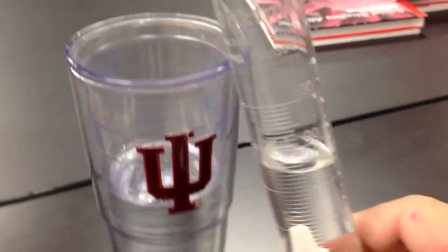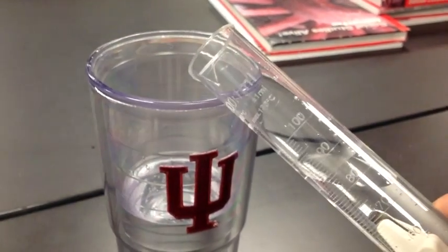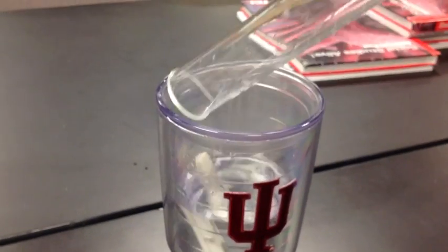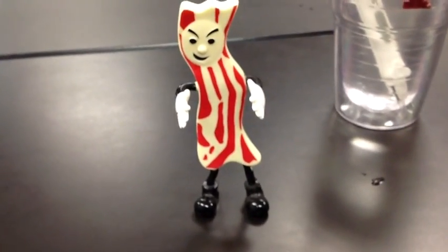To get it out, I just go back to where I got my water from. Pour it out gently and get my item out. Thanks Mr. Bacon for helping us out with this again today.